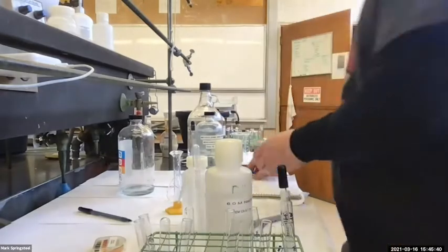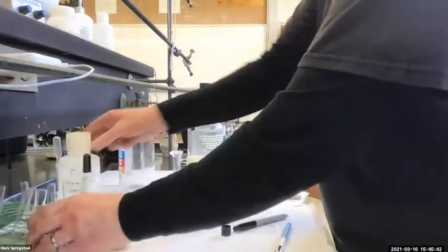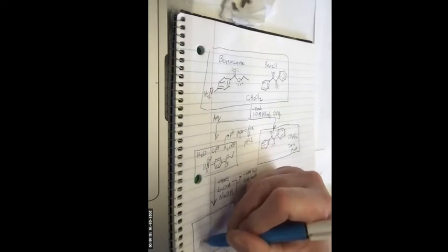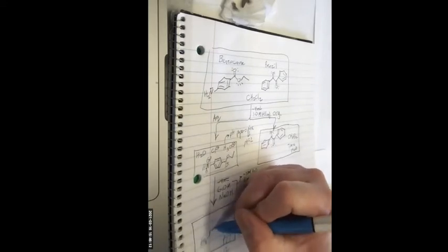Okay, so now let me fill in my extraction diagram, see where we're at. So it looks like at this point, I did get a precipitate, and the pH was like purple, huh? Maybe a pH of like 12 on the pH paper. Okay, so I believe I have the amine again, the NH2, not the ammonium. Because it no longer has charge and it's a pretty organic molecule, it's not going to want to be soluble in water. It's going to form that precipitate.